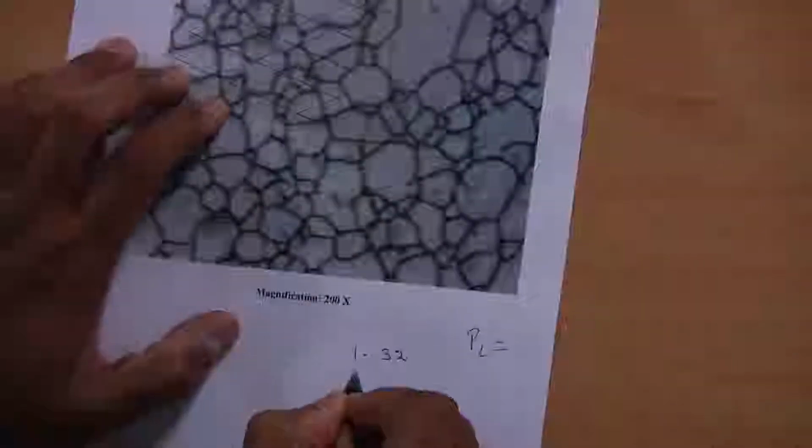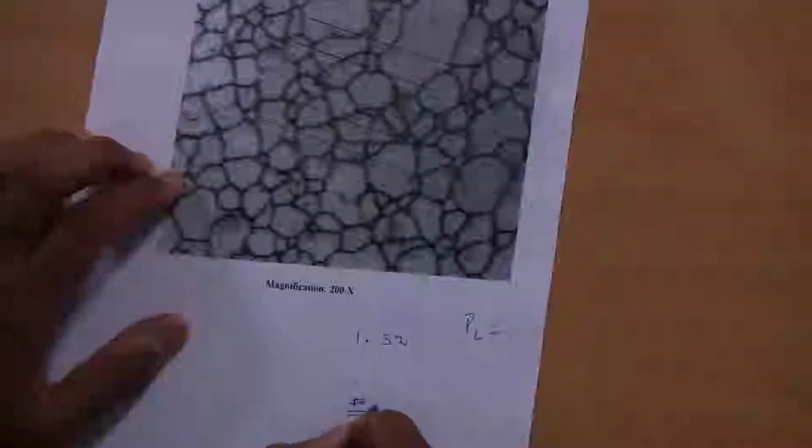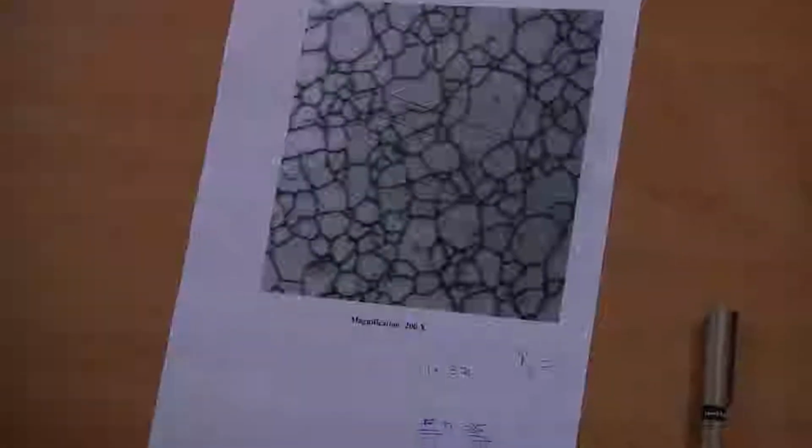Like that I can keep on going up to n events of different orientations like this. In fact, I have done similar counting up to the n value, not capital N, a small n, up to 35, which I have tabulated in the Excel sheet. Now, I will go back to this calculation.